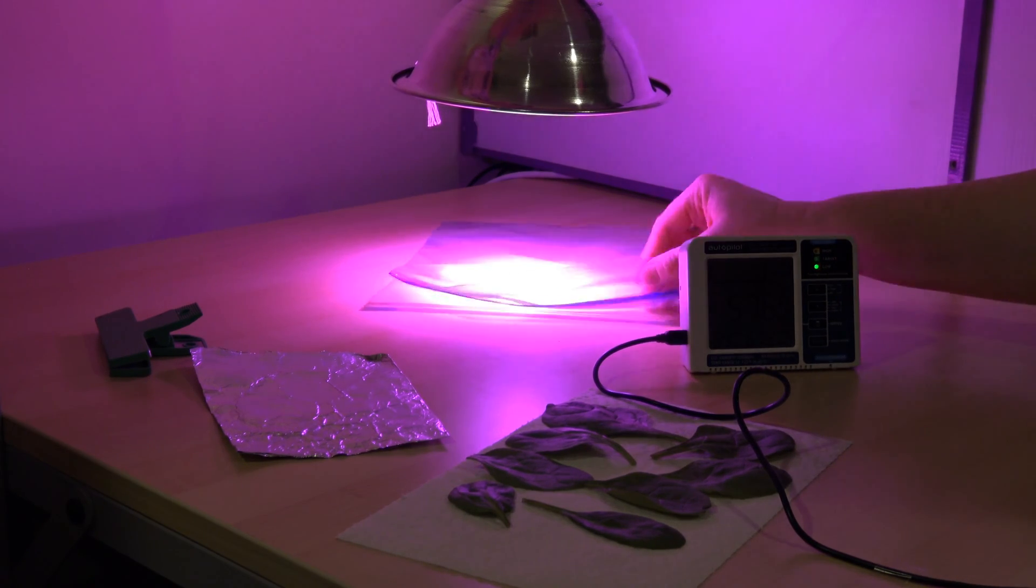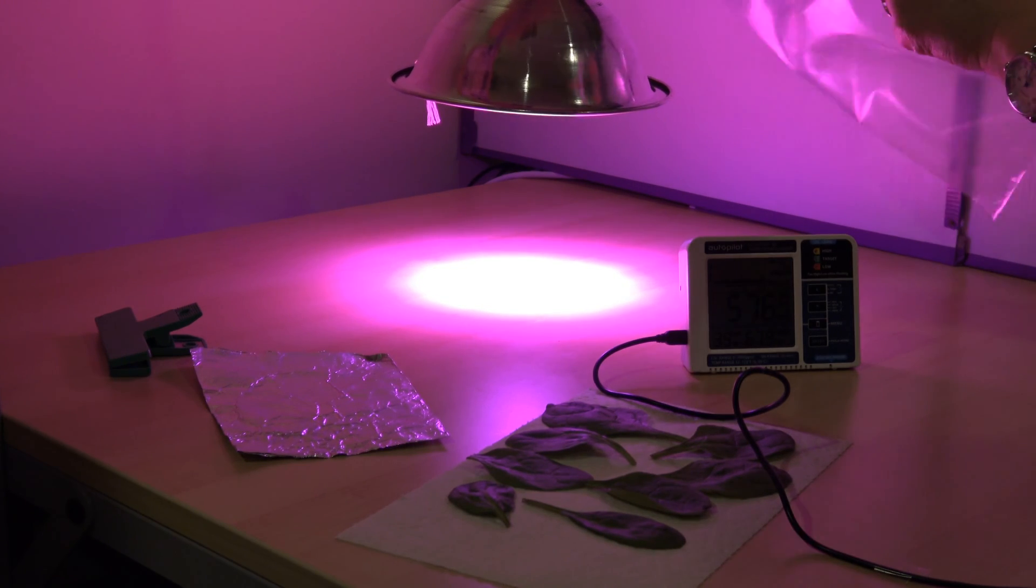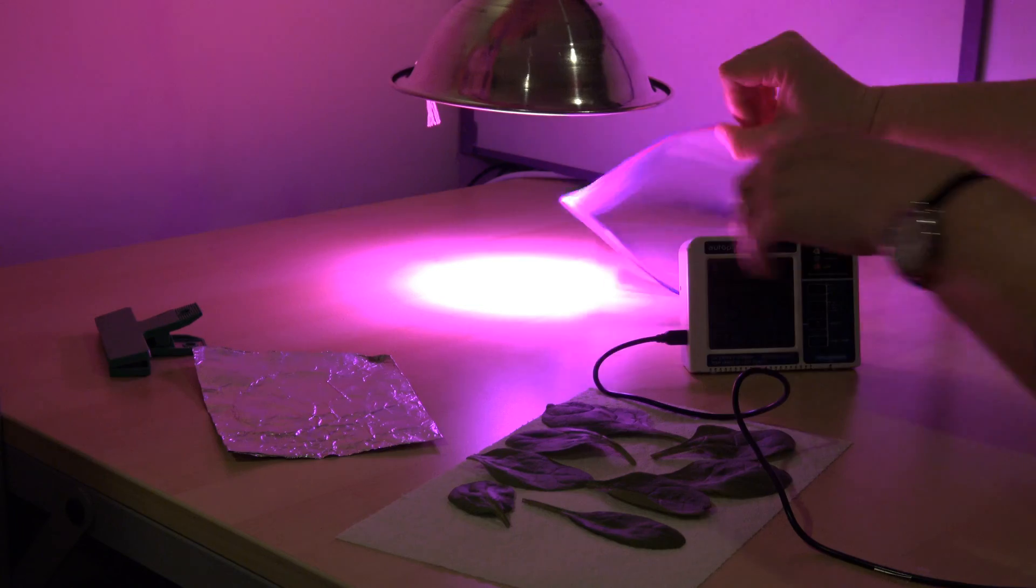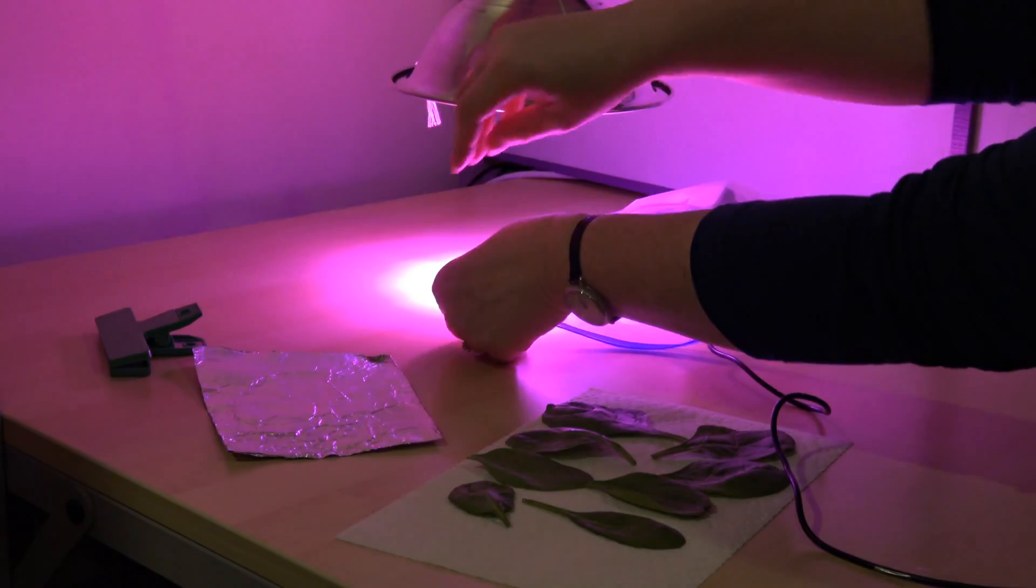The first thing we want to do is open the plastic storage bag, swish it around to get it full of the room air, and then place our detector inside.